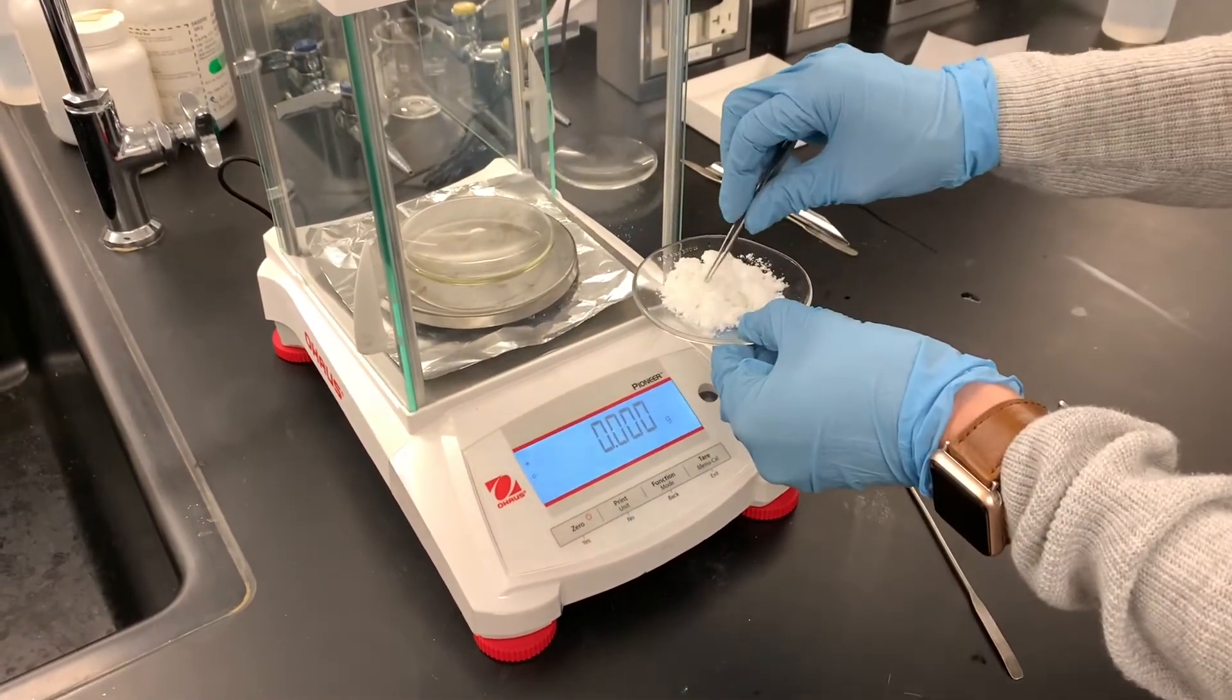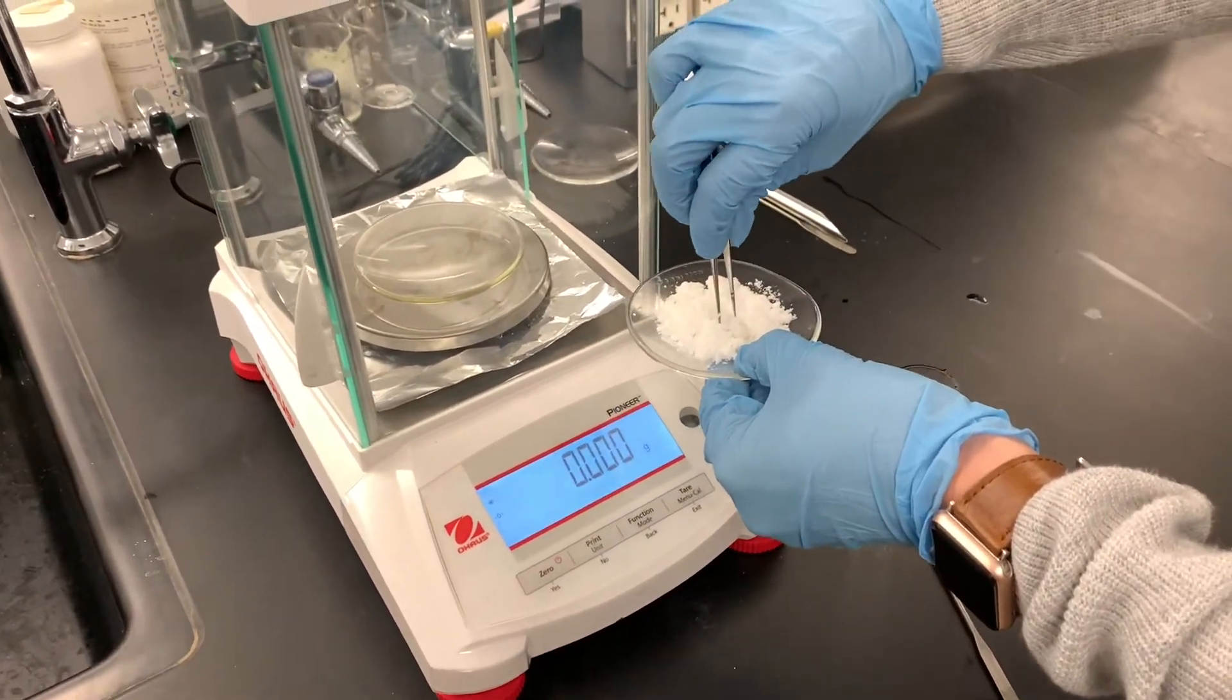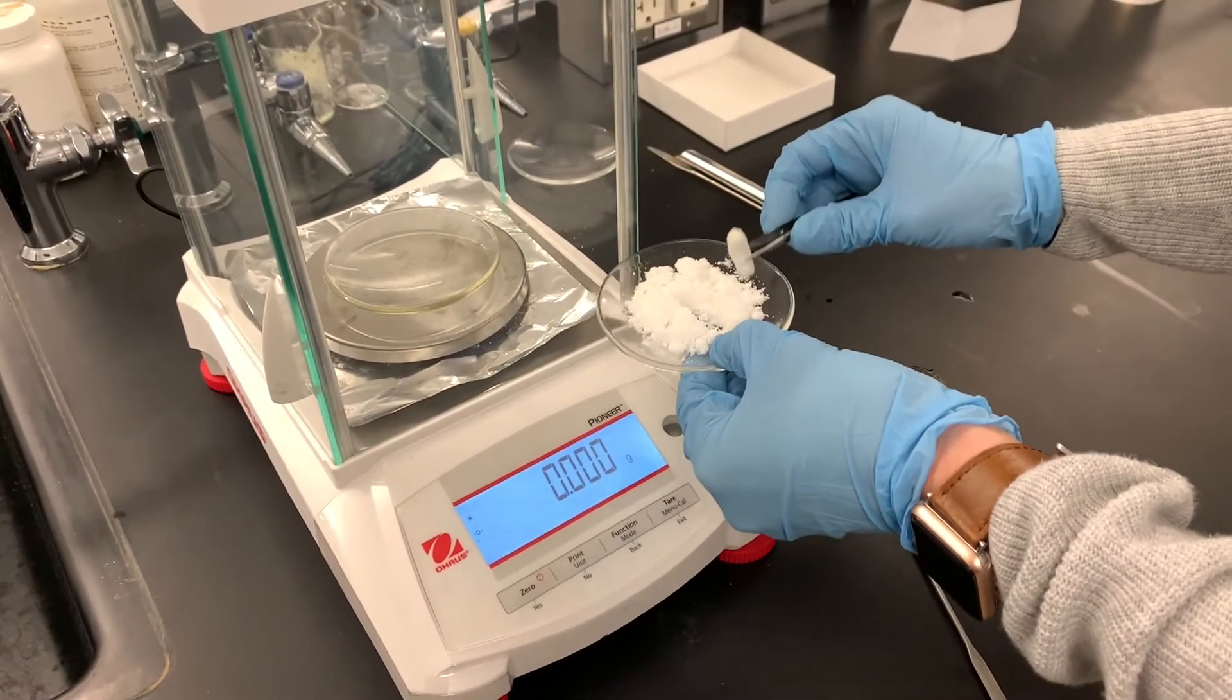And when I filtered this yesterday, my little stir bar ended up in the product, so I'm just going to set that aside.